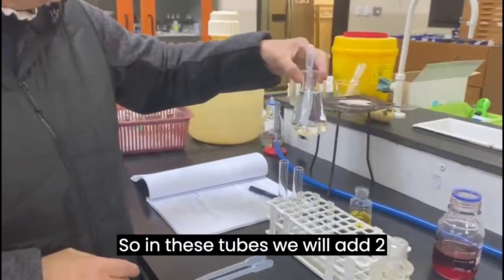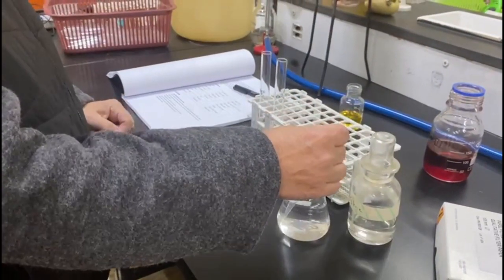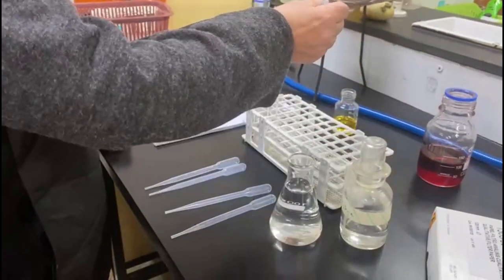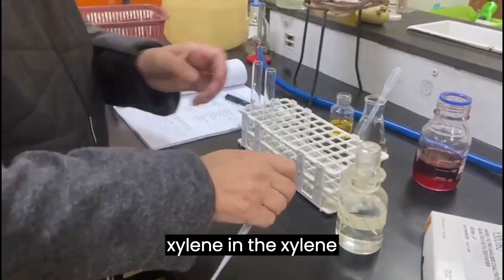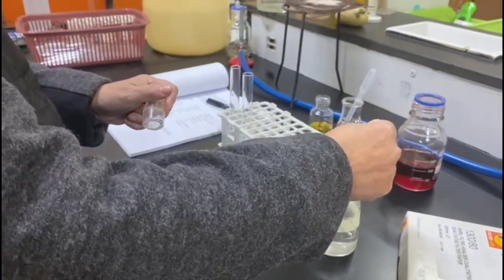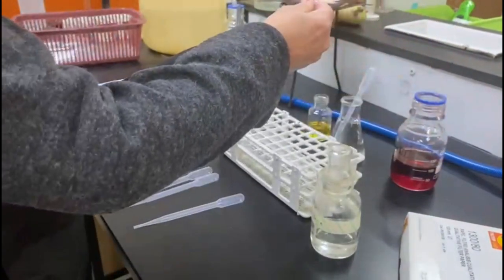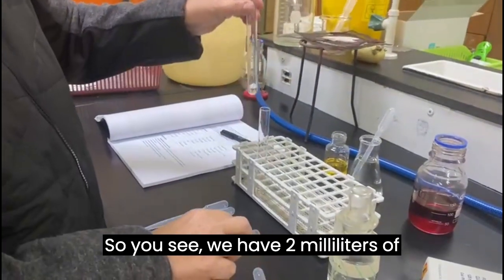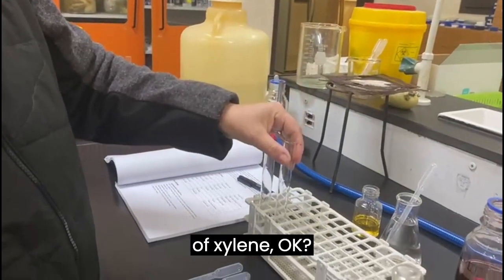So in these tubes we will add 2 milliliters of water for the water tube, and we add 2 milliliters of xylene in the xylene tube. So you see we have 2 milliliters of water here and 2 milliliters of xylene, okay?